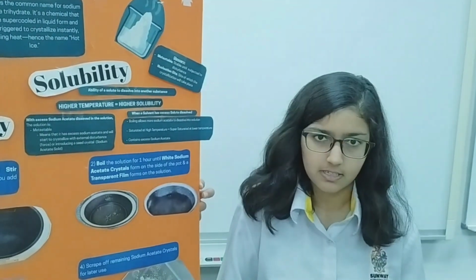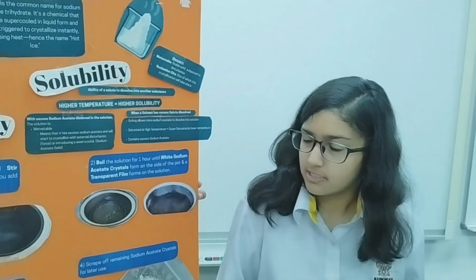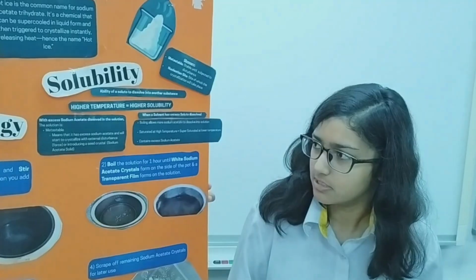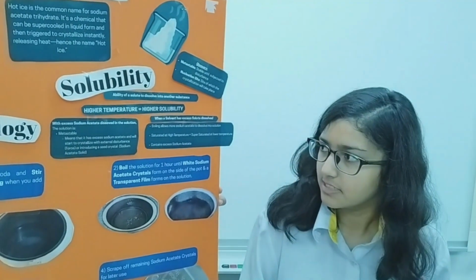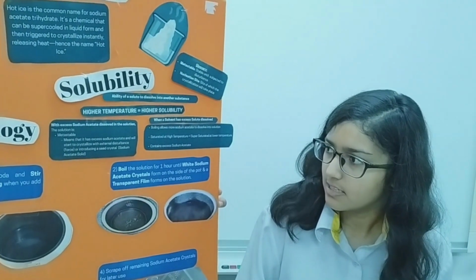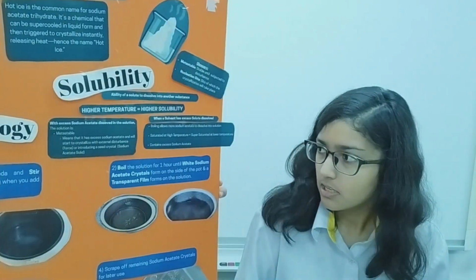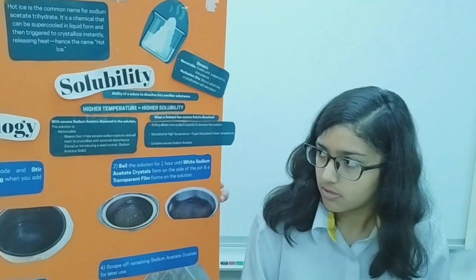in excess sodium acetate. That means the solution is considered metastable as it has excess sodium acetate and will start to crystallize with external disturbances, also known as force, or when you introduce a seed crystal, which is solid sodium acetate.